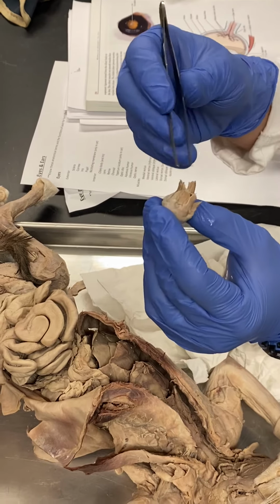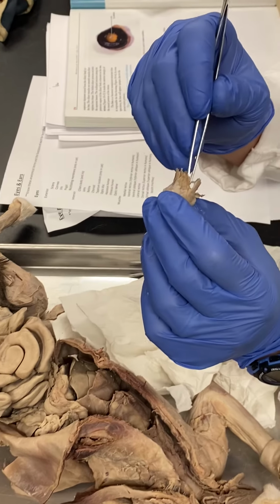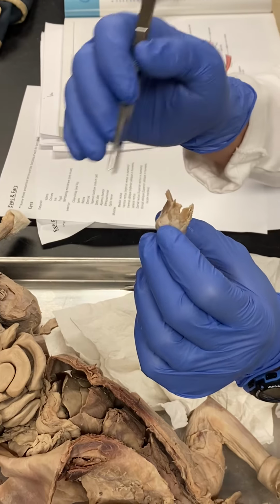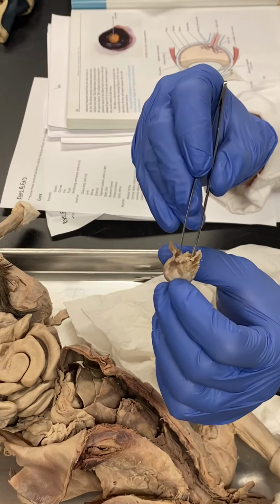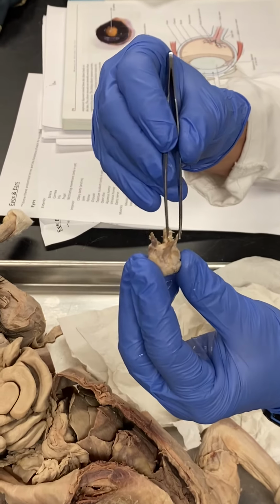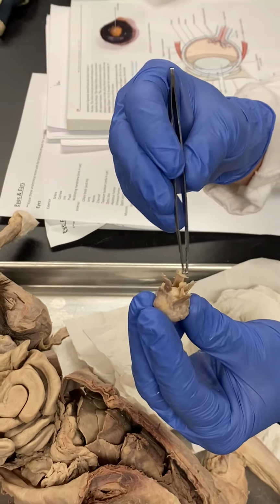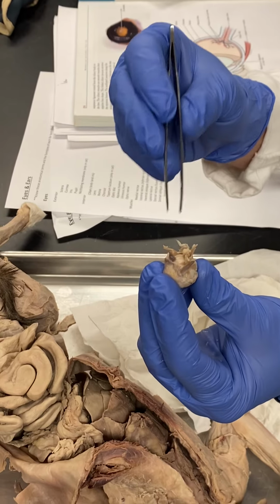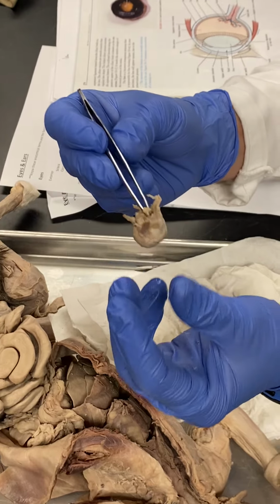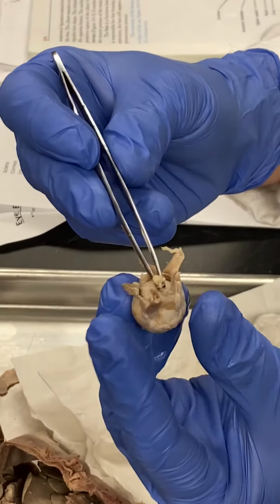Then we can turn it over. And you saw me take it out of the left eye, so you already know it's a left eyeball, but on an exam, I might ask you, is this a right or left eye? My job here right now is to teach you guys how to tell. And so first we've got to orient, and I'll have the muscles situated in such a way that hopefully it's easy for you guys, okay? So first we've got to locate, what is this that I'm holding on to with my forceps? The optic nerve. That is the optic nerve, okay?